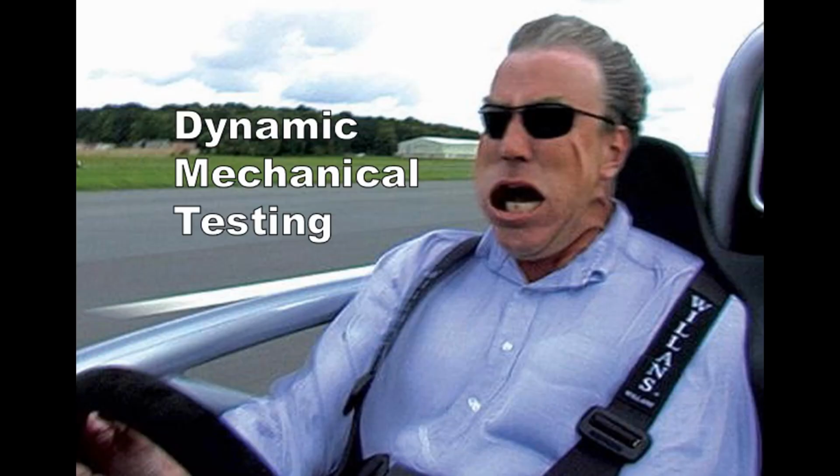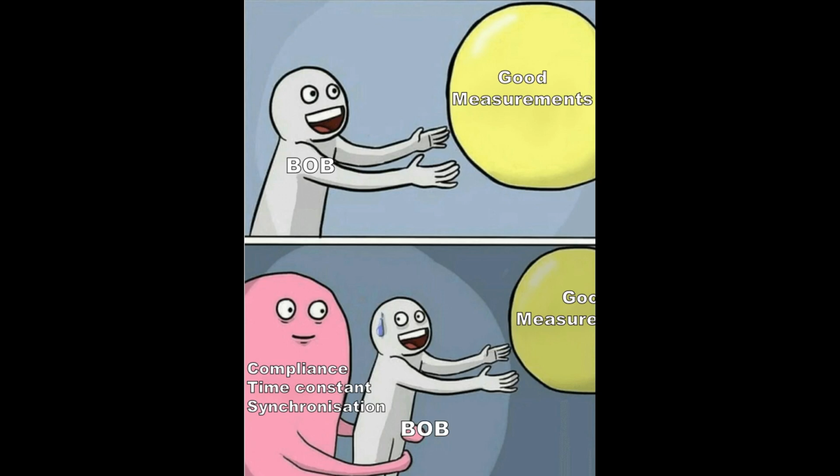Bob's problem is very common in the field of high-speed deformation mechanics. The deformation velocity or strain rate can be up to 1,000 per second. Only a sampling rate above this value can also resolve the force-to-depth curve right. Also important is the synchronization of all measurements to the time. This ensures correct evaluations of hardness depending on strain rate.